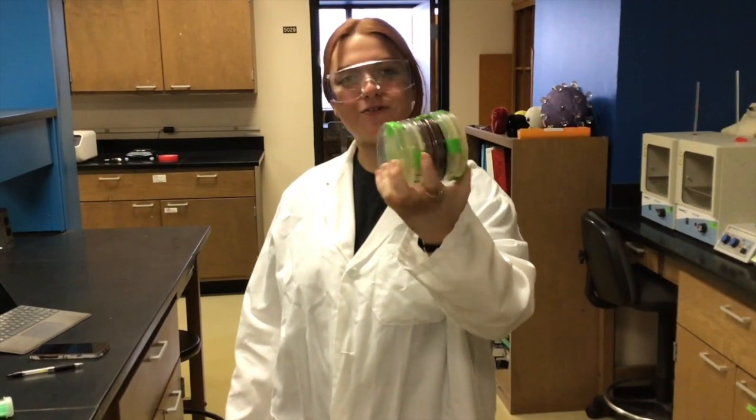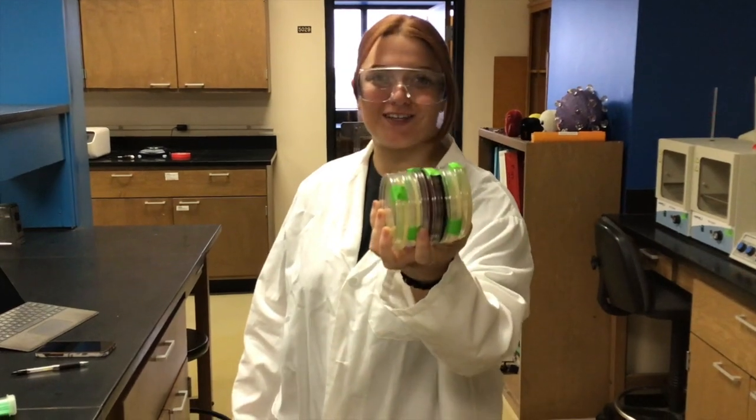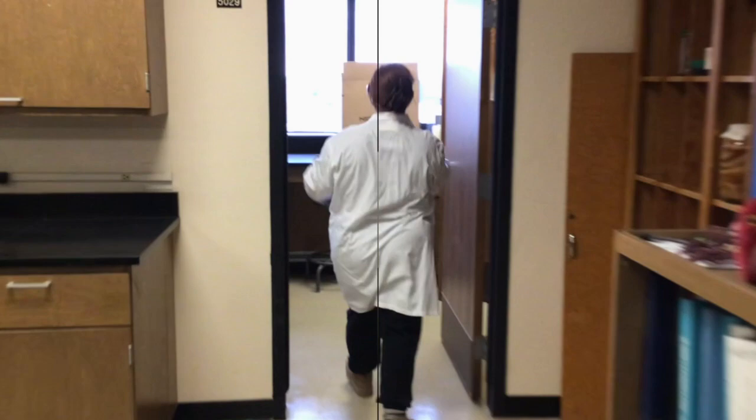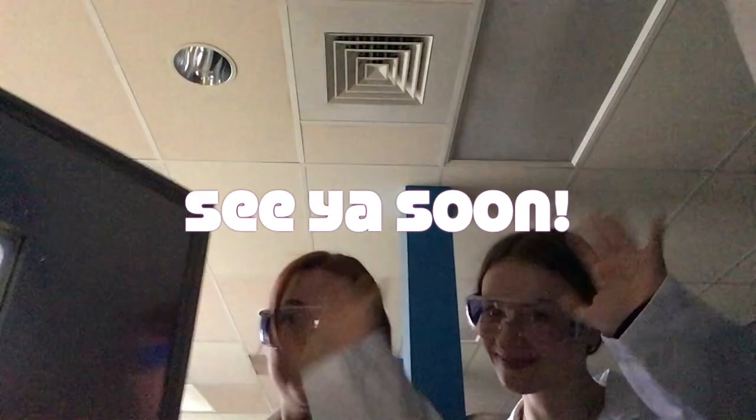Now that we have all of our microbial masterpieces ready to go, let's go incubate these puppies. Depending on the type of bacteria you're using, you're going to want to incubate it for a different amount of time or at a different temperature. We're going to be incubating these bad boys at 37 degrees Celsius for a couple of days. We'll see you.